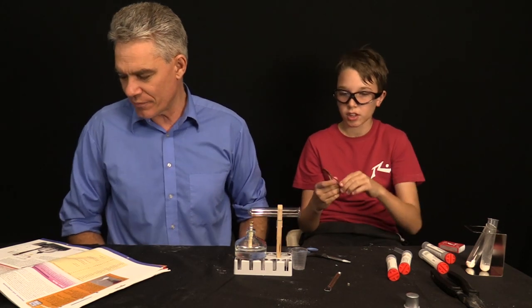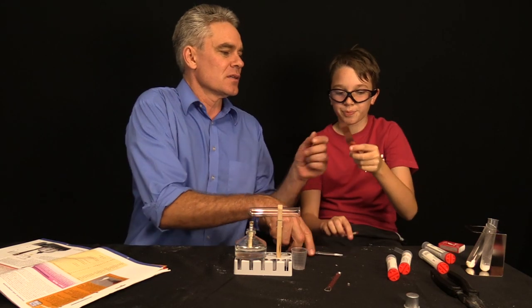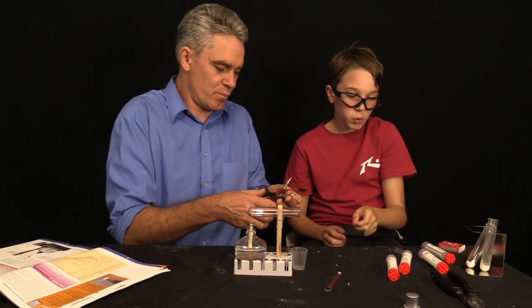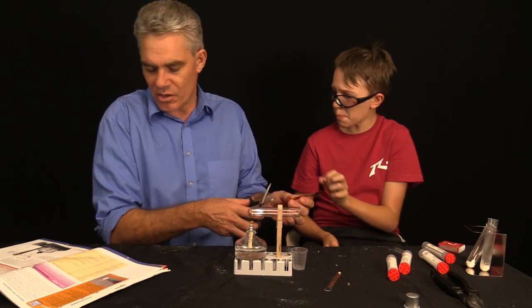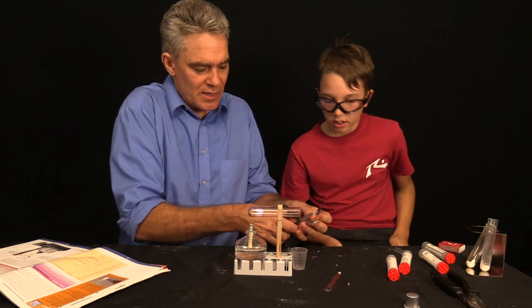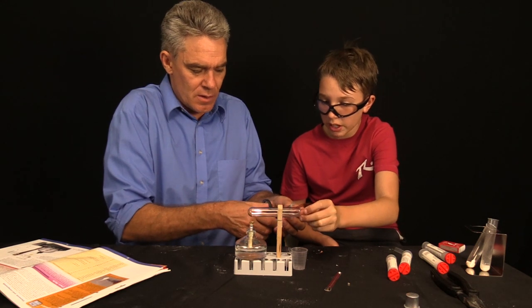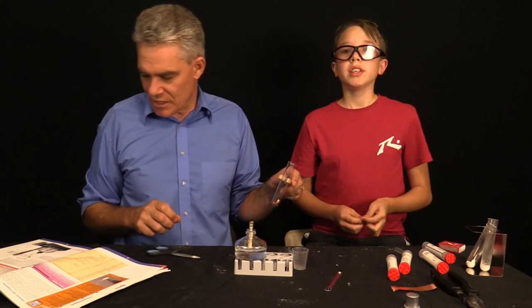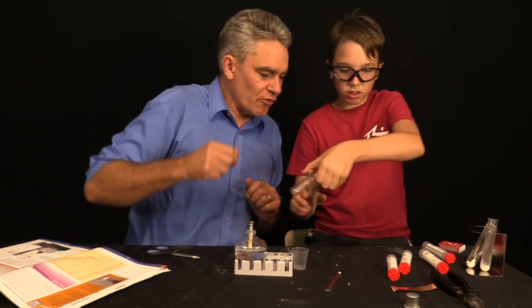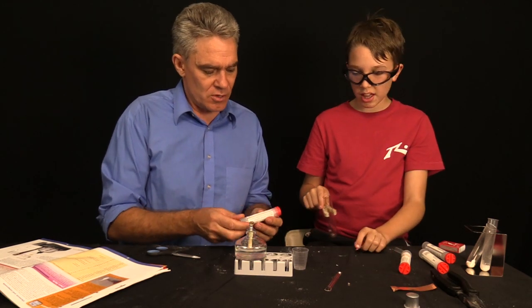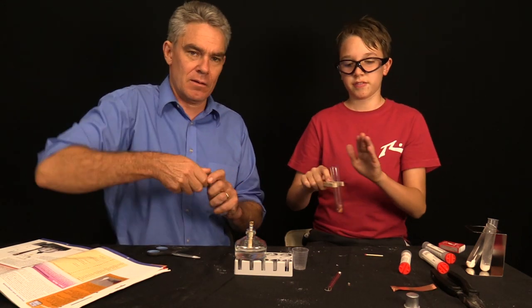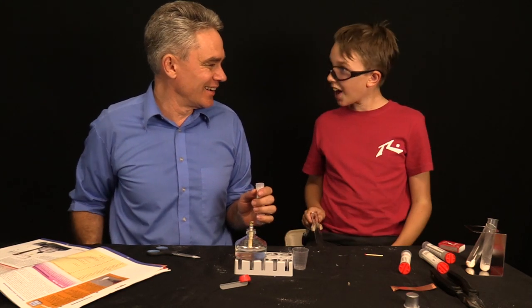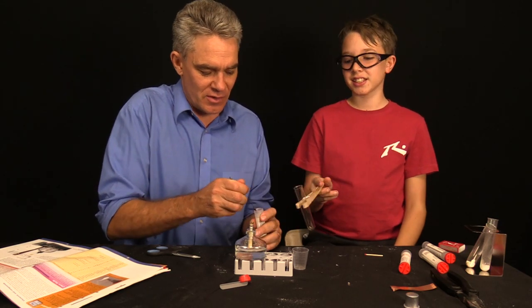Apparently, we're going to be heating up some copper. It says a one by one centimeter piece. So, can you cut one centimeter off? Do you know one centimeter? Copper is a brown. I'm going to put a few little strips in to make it work a bit better. Get a bit of good surface area. Down to the bottom, actually. Where the heat is. Will you pop those in? Copper, good conductor of heat, good conductor of electricity.